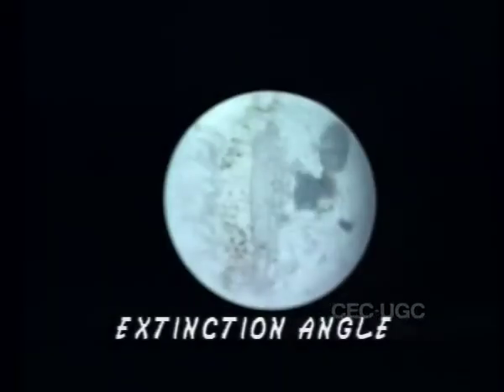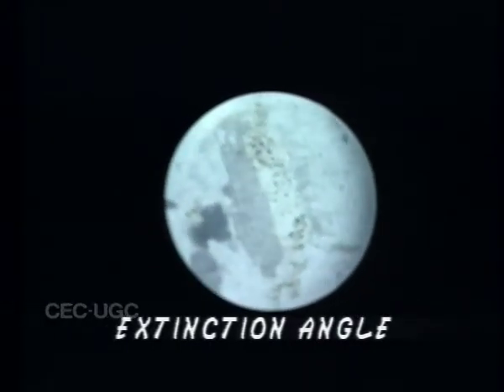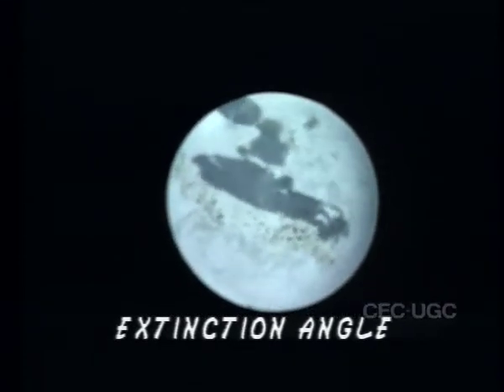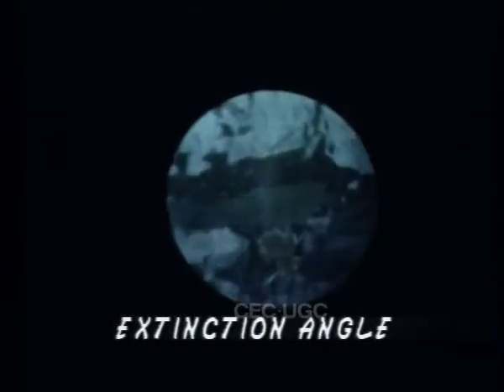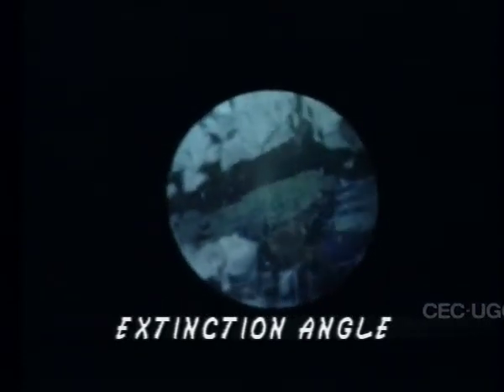When a grain of anisotropic mineral shows cleavage lines, crystal faces, or elongation along one axis, the angular relation between any of these crystallographic orientations and the extinction position can be observed. By this relation, it is possible to distinguish uniaxial and biaxial minerals.